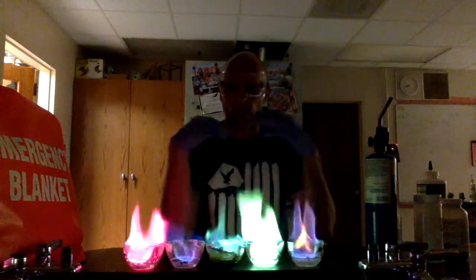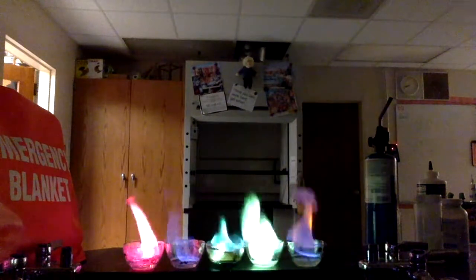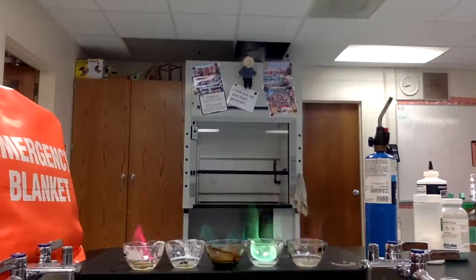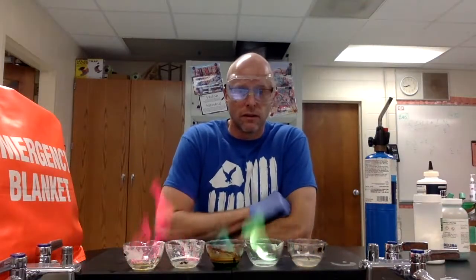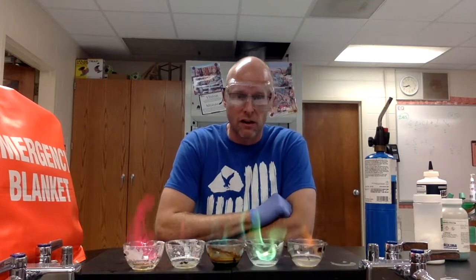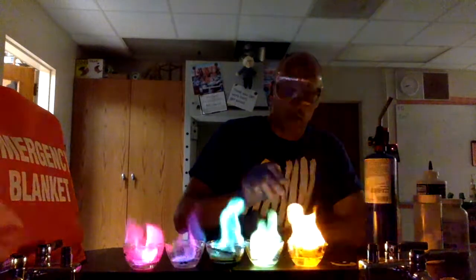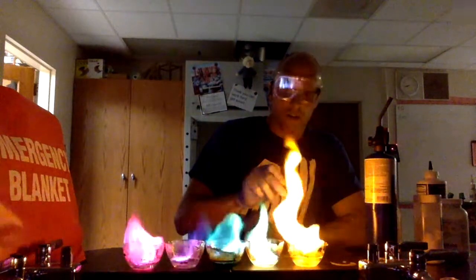I'm going to switch the lights on and we'll get a slightly different perspective. You can still see the colors, not as clearly though. There's our sodium.